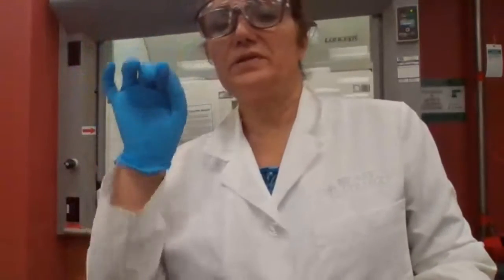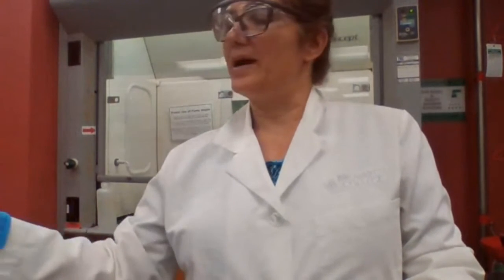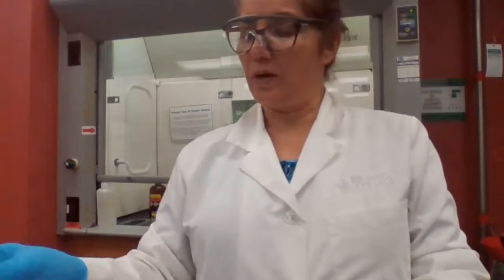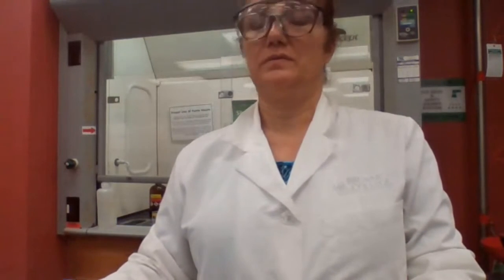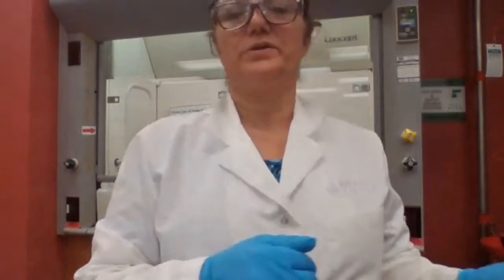We're testing solubility. FeCl3, that would be ferric chloride, is for classification tests. For solubility, if you look at the chart, page 181 or 183 for ebook versus hard copy, we are going to test with sodium hydroxide.